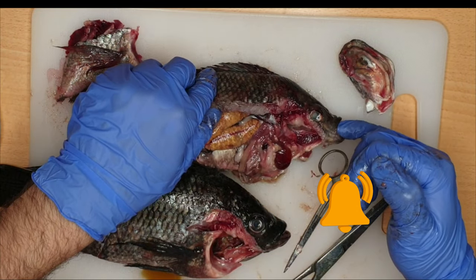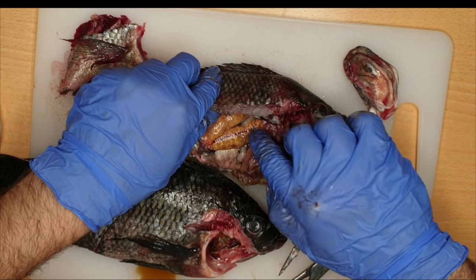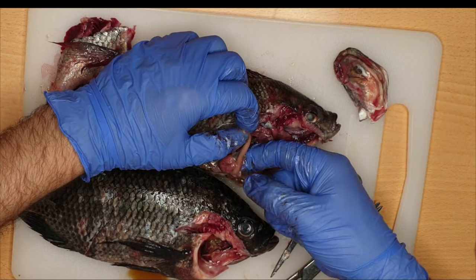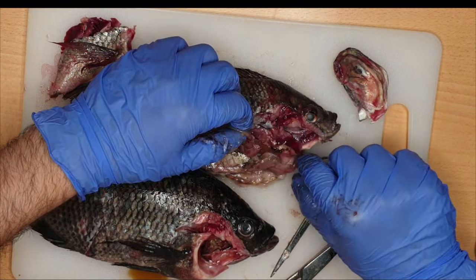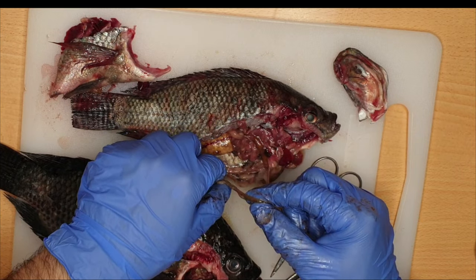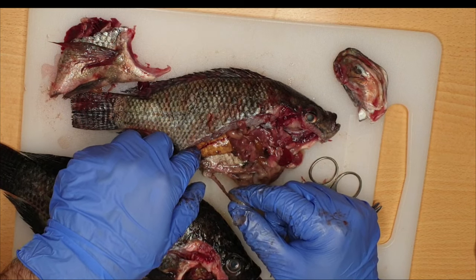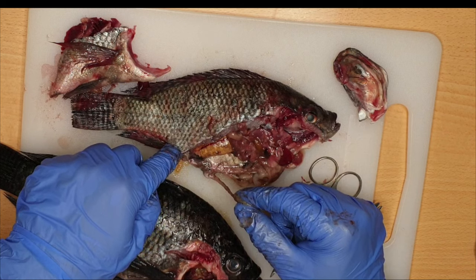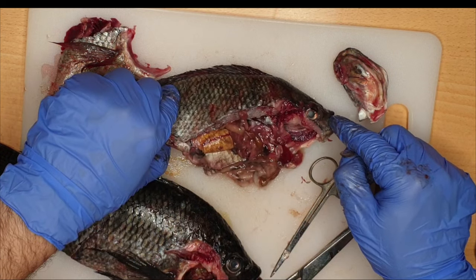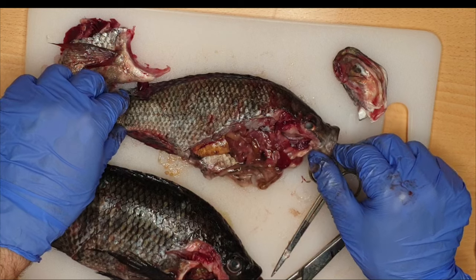Regarding the internal viscera: after the mouth it opens into the pharynx, after the pharynx we have the esophagus, after the esophagus there is the stomach, after the stomach there is the intestine, and those intestines eventually open into the cloaca. The cloaca receives the digestive waste products along with the metabolic waste from the urinary system, and both together will be excreted to the outside of the fish through the anal opening. This is the general viscera of the tilapia, which is an example of bony fish.